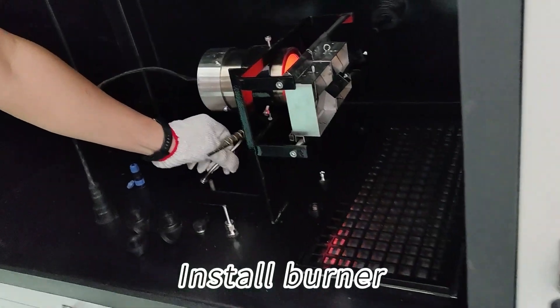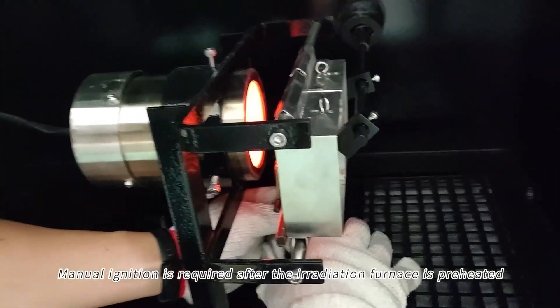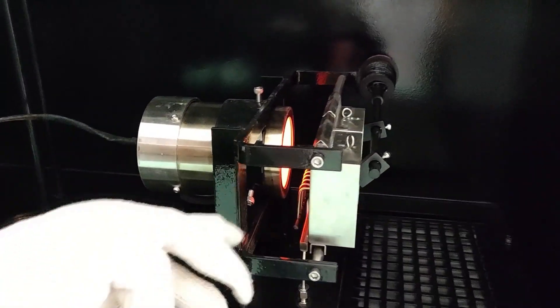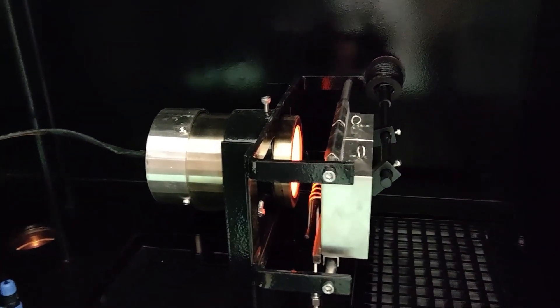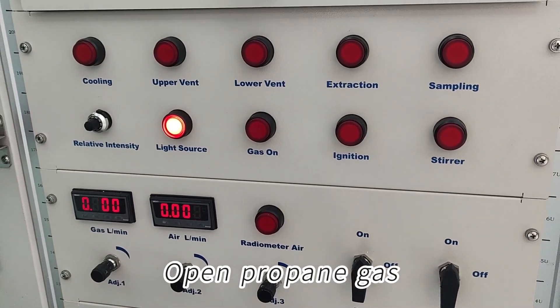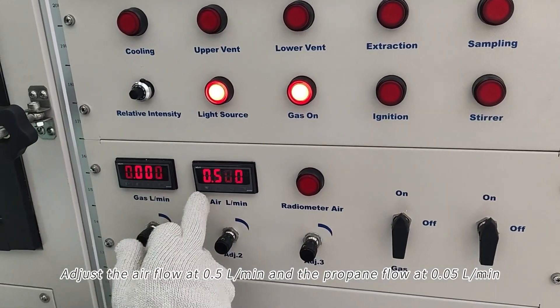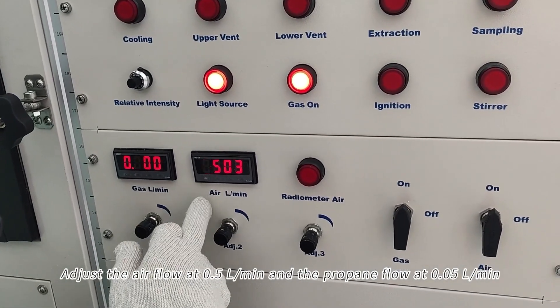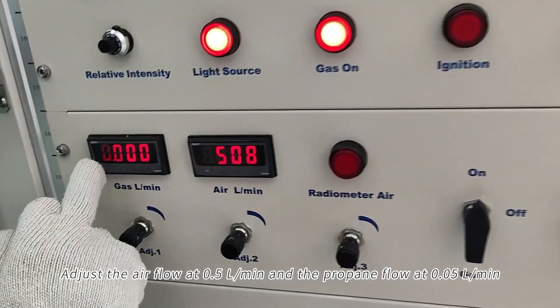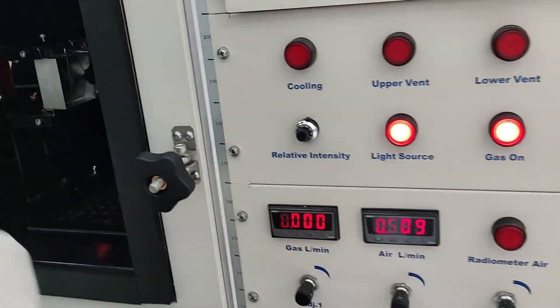Install the burner. Manual ignition is required after the irradiation furnace is preheated. Open propane gas. Adjust the airflow at 0.5 L/min and the propane flow at 0.05 L/min. After igniting, confirm the gas test is normal.